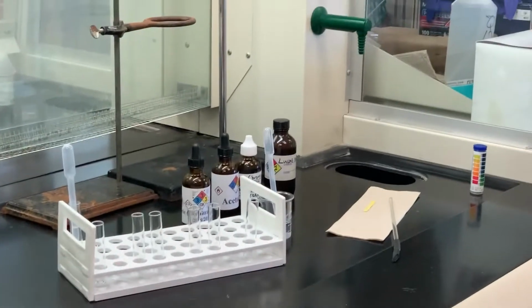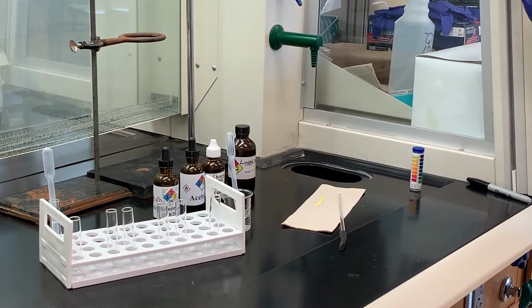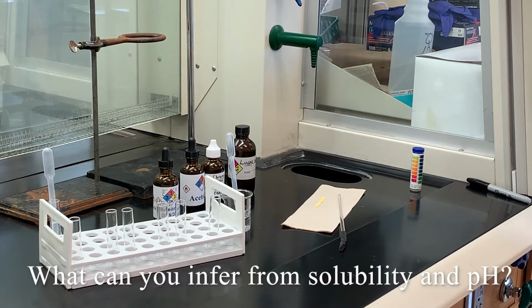If that is pH 6 and it was soluble in water, if you go back to the solubility chart, what does that tell you? What type of compound is it? A pH of 6 is neutral, so now I'm looking at a neutral substance that is soluble in water. What can you infer about that compound? If it's neutral, think about what functional group it would have.